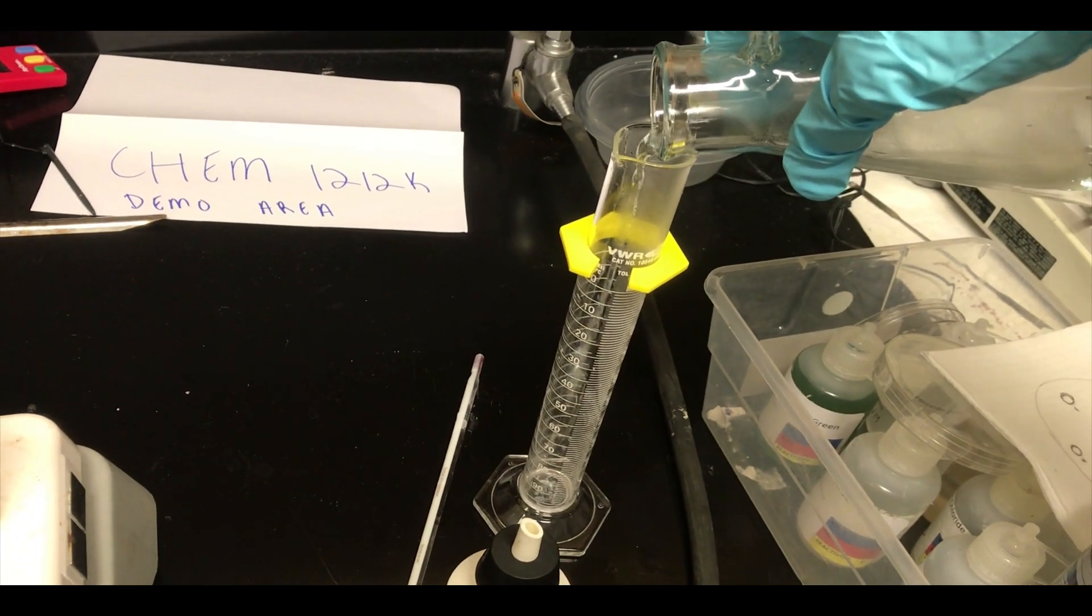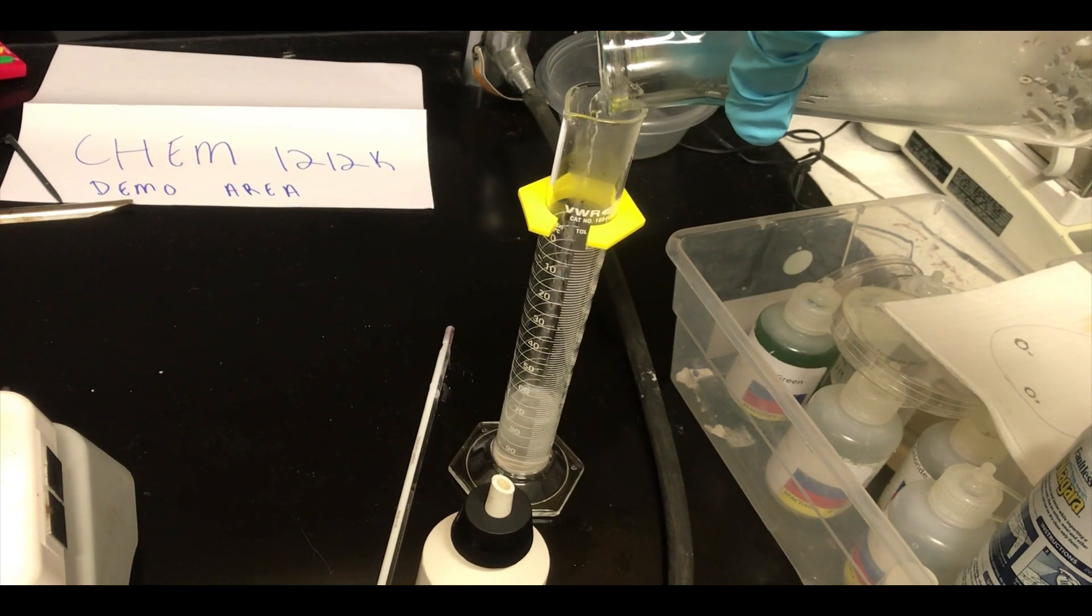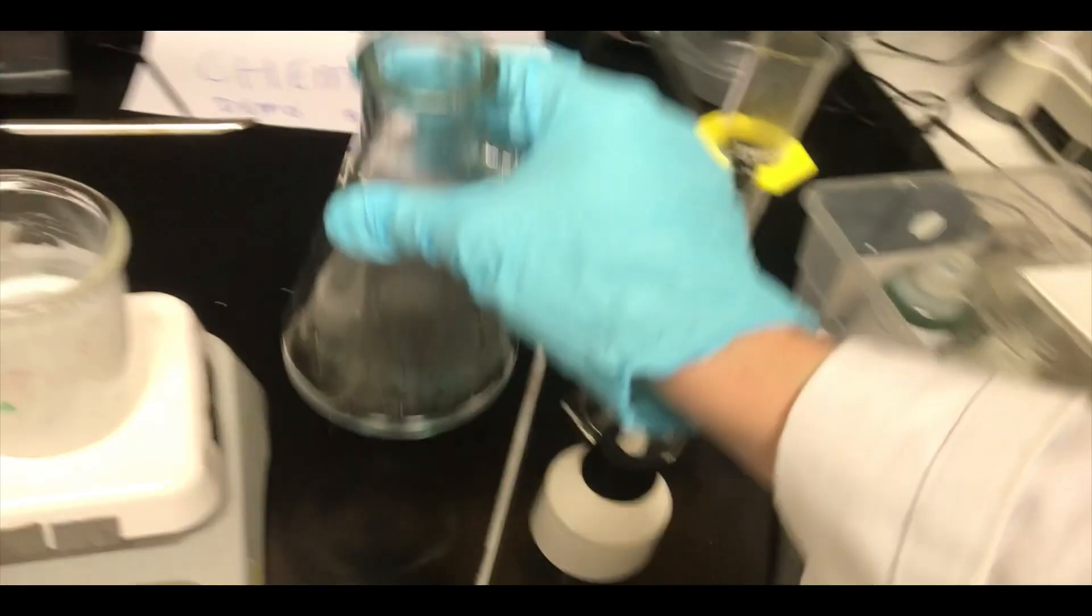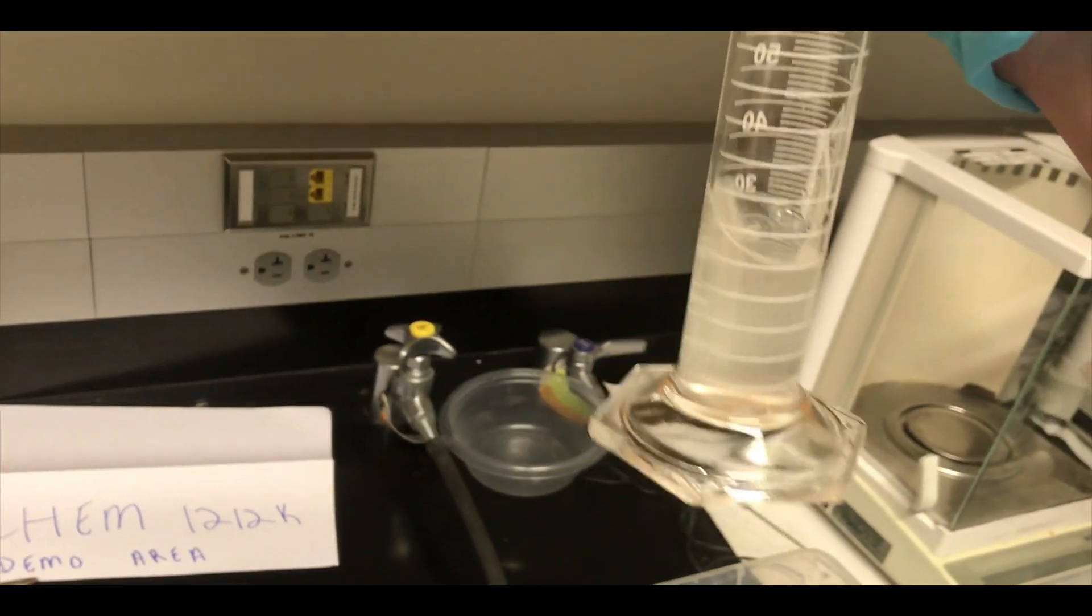And now we're going to try to measure out as close to 30 milliliters as we can. Again, it's not critical that you get exactly 30 milliliters here, as long as you measure to the nearest 0.1 milliliter once you've transferred into the graduated cylinder.